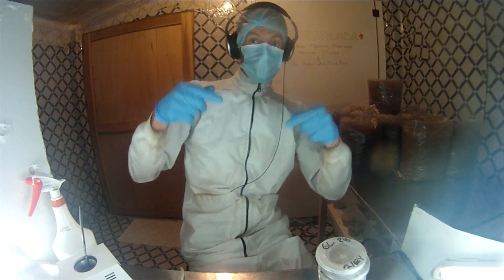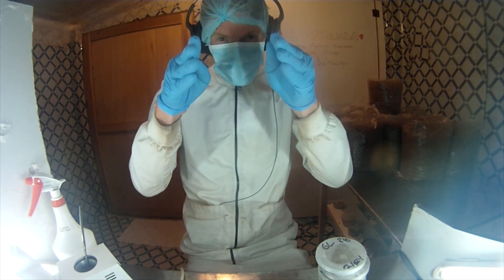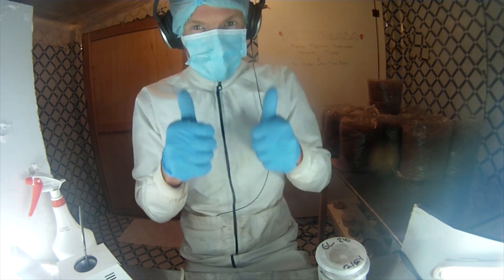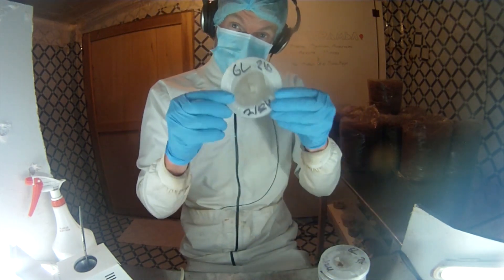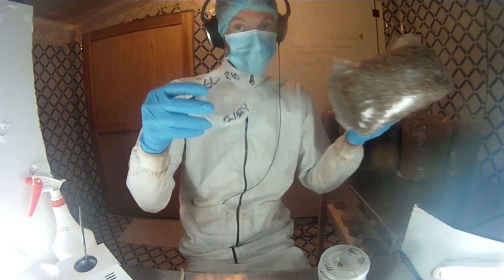We are in my lab. It's awesome. I'm talking to you — well, not exactly, because I got this thing on my face, so I'm going to project it into your brain. I'm using a voiceover. This is years later; this is old footage. We're putting petries into grain blocks.